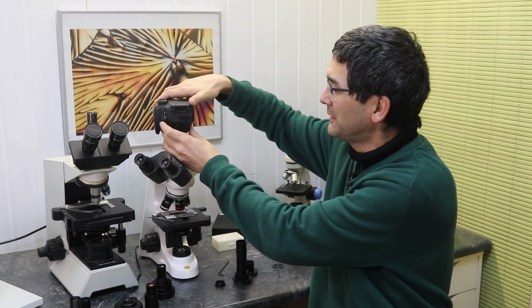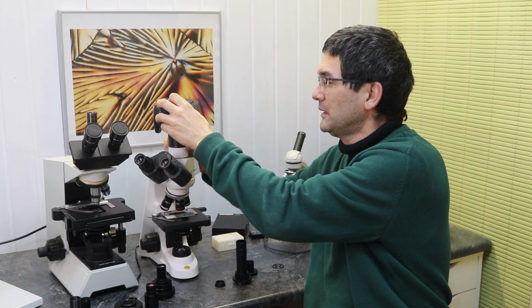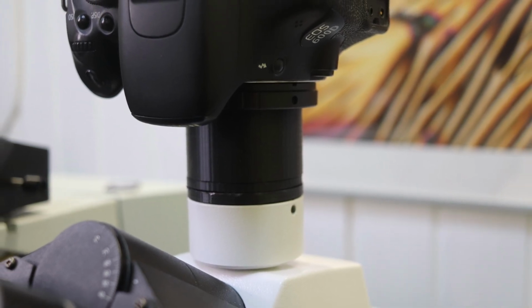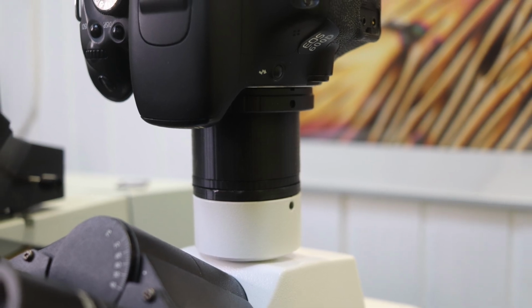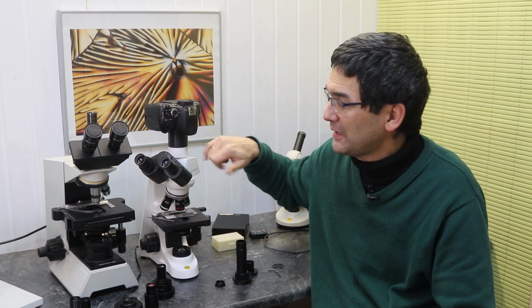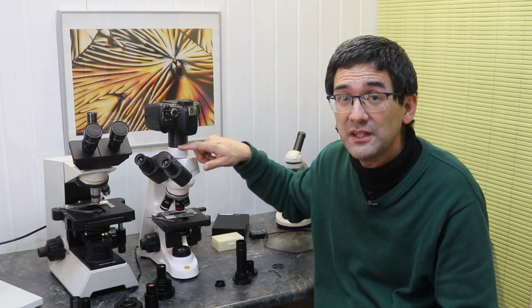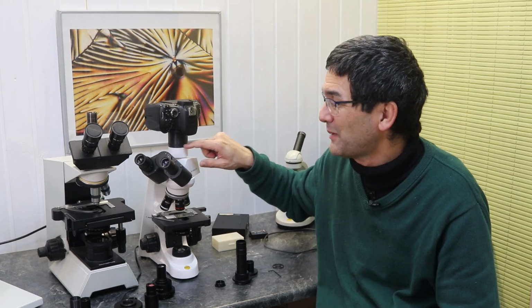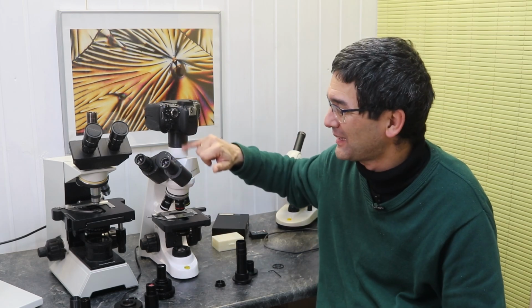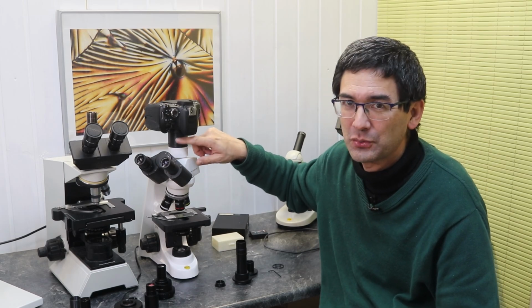Again I have to find the proper alignment here. Okay, I can again directly connect the camera. Let me turn this around again, in such a way that I'm able to take pictures. So this is basically my solution here, and it works surprisingly fine. Again, the optics are now responsible for creating the image directly on the sensor, and the difficult part now is finding the correct distance, because if the distance is not correct, then it's again not in focus. It's the reason why I added an extra ring here, an extra piece to adjust the distance. It was estimated, and then I adjusted the size stepwise a little bit until it was the correct distance.